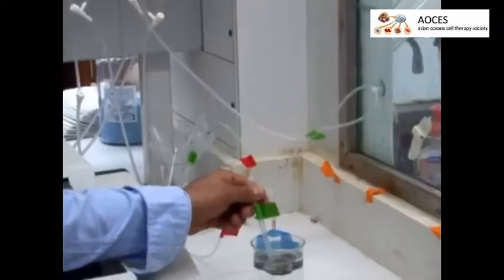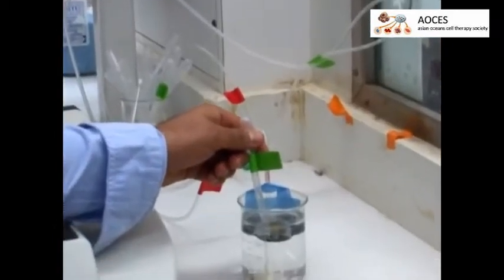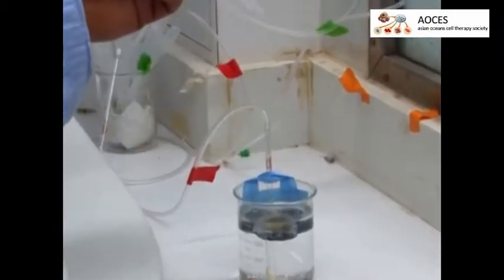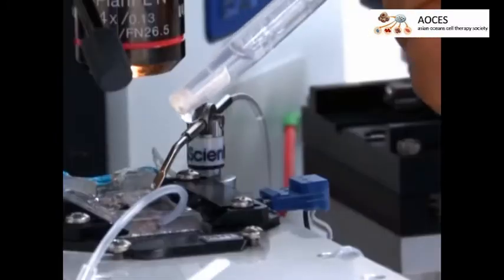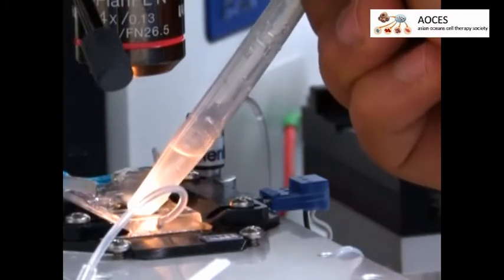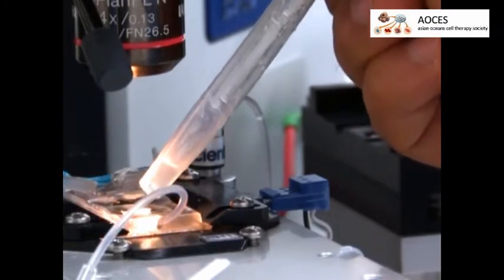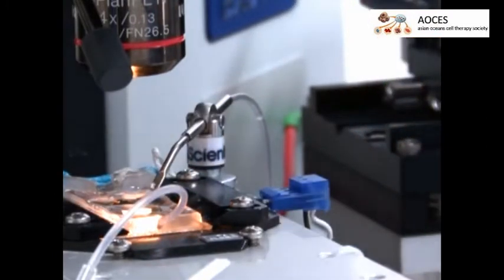To begin this procedure, using a plastic trimmed tip transfer pipette, gently draw up one brain slice from the recovery chamber. Place the transfer pipette in the recording chamber and gently squeeze the slice out of the pipette onto the coverslip lining at the bottom of the chamber.